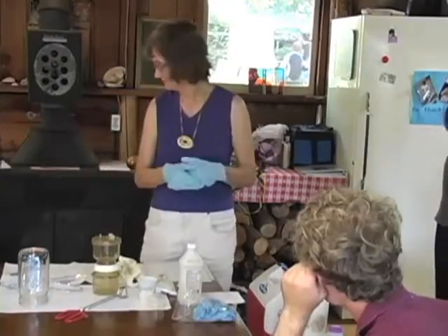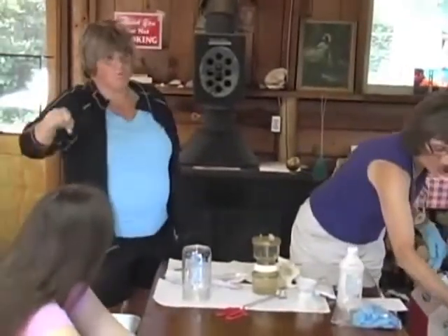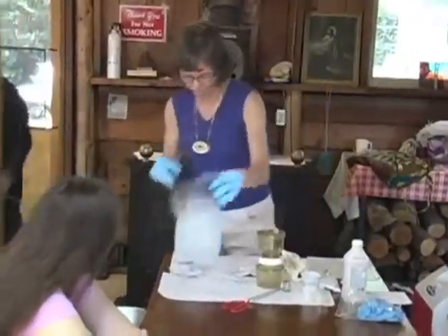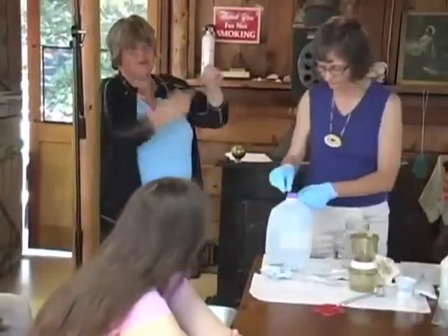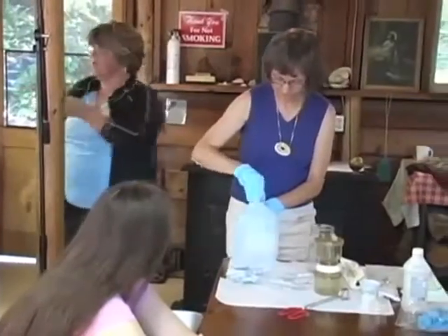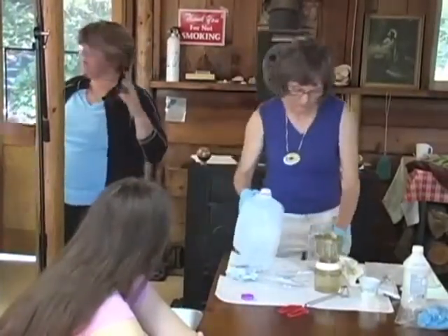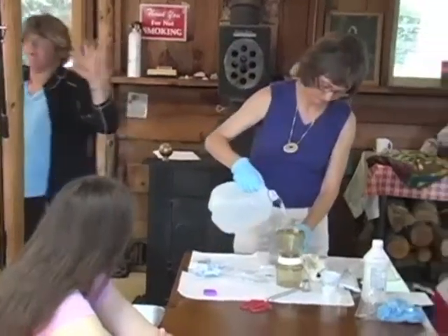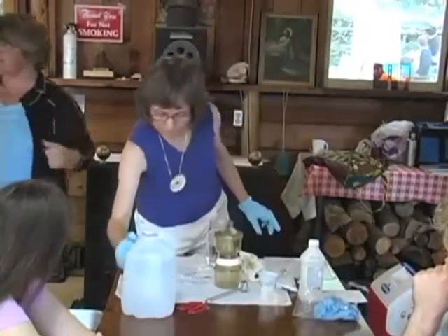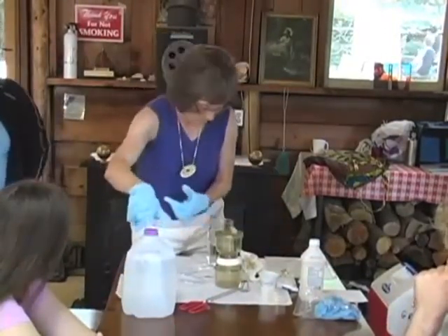And just while she goes on, if you're taking water samples from a central watering point, there are things you have to be very careful about. Do not touch the inside of the bottle. Do not let the inside of the bottle touch the spigot or the cloth. You really want to get it underneath the water where it's not being touched by you, because you could have stuff on your hands too, or the spigot could have stuff. So in order to test the water, you've got to get just water. Don't touch the inside at all. Okay.